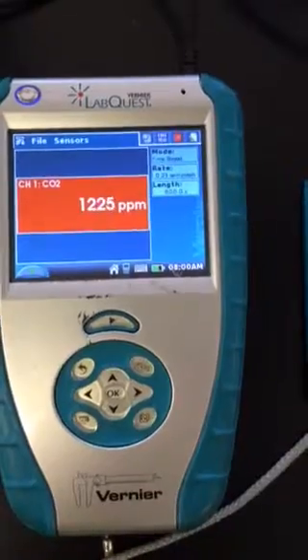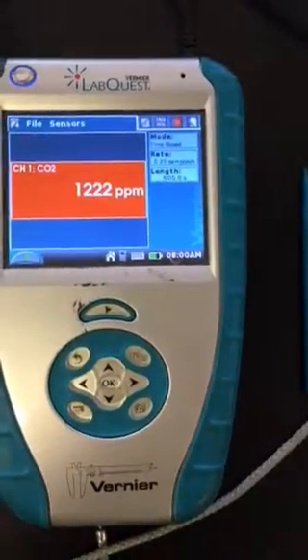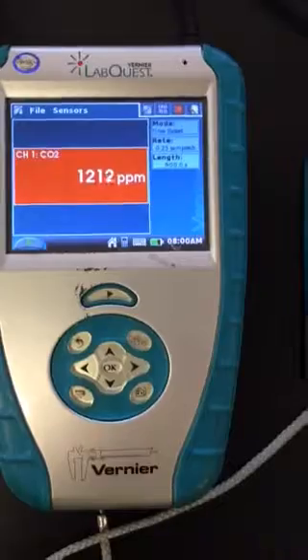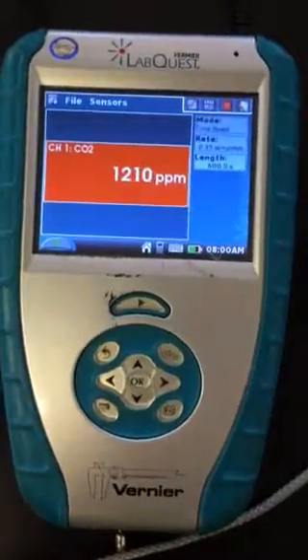And you've waited 90 seconds to let it normalize, plus waited an extra 60 seconds or so for it to stop increasing. So that's one way to do it. That's a little bit less accurate, to just wait and make a judgment call.